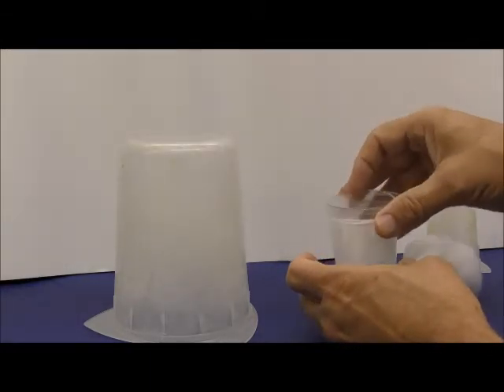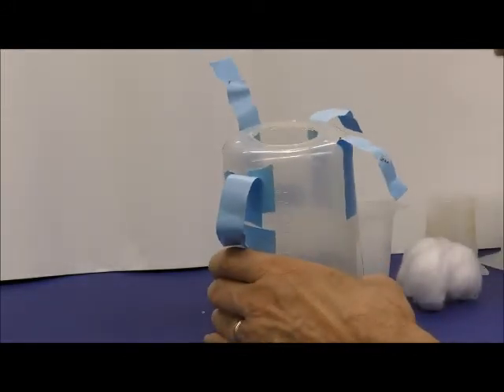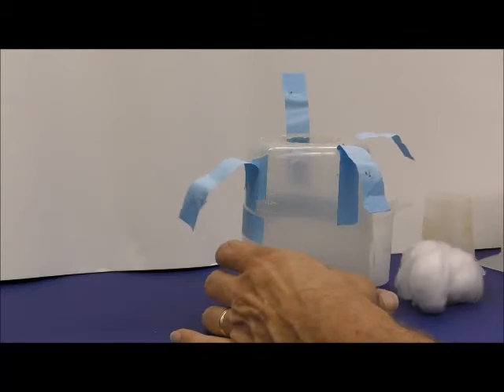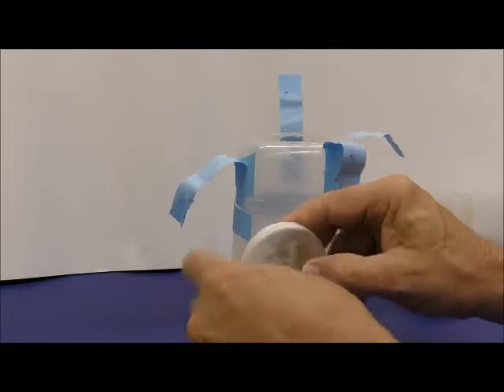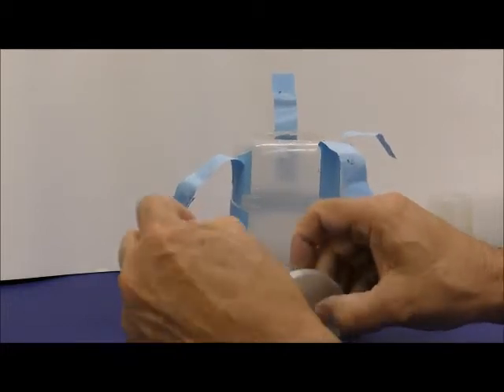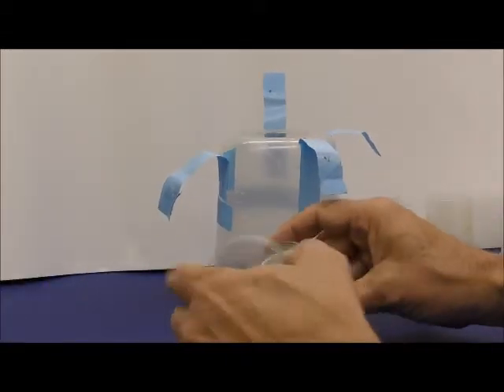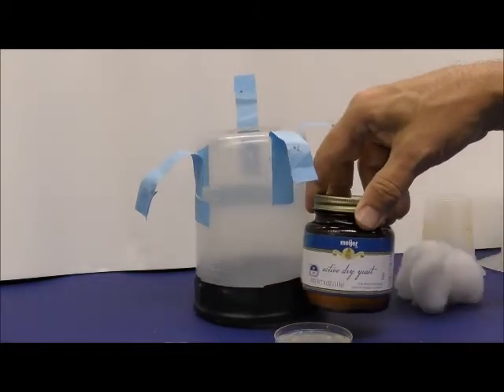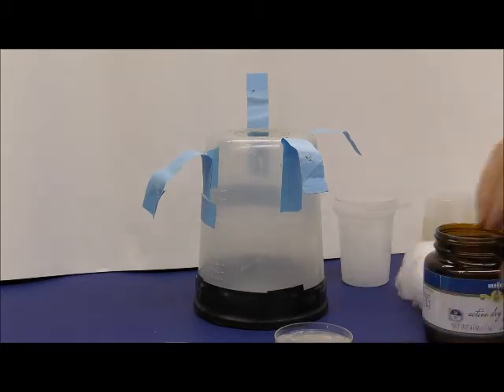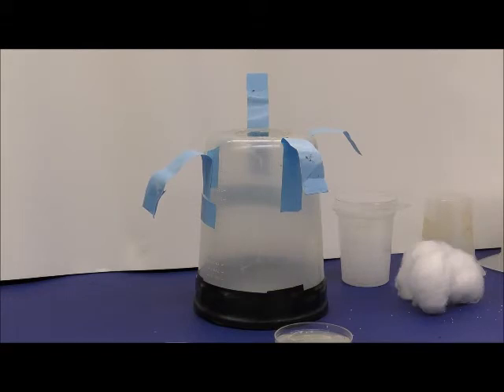And if you want to use this type of container, which was one of these, it's relatively easy, because then you can take your agar dish, which I make ahead of time and put in the refrigerator so the agar is ready to go, and I put Saran wrap or something around the edge. Now I have an agar dish, and one can take a little bit of baker's yeast and drop just a tiny bit on there. That will encourage the flies to lay eggs.